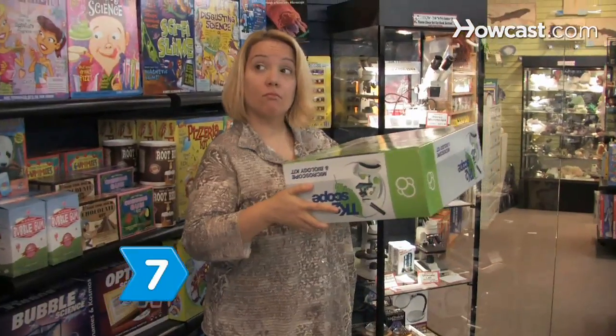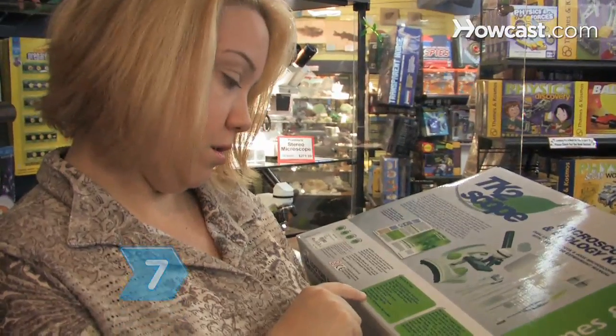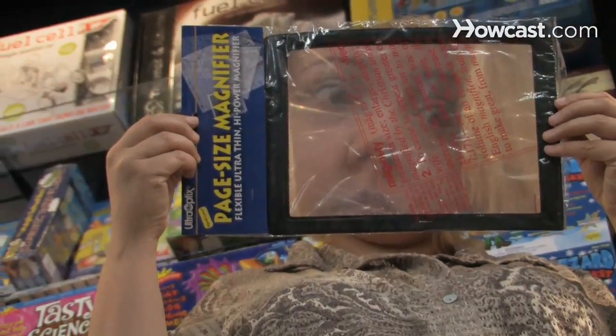Step 7. Assess the package to learn what accessories are included in the price and what else you may need to buy.